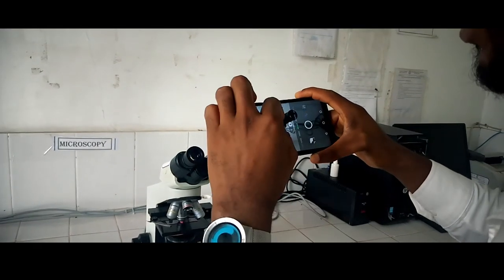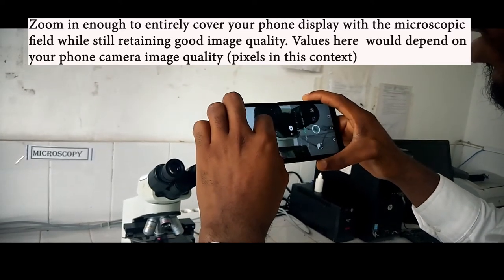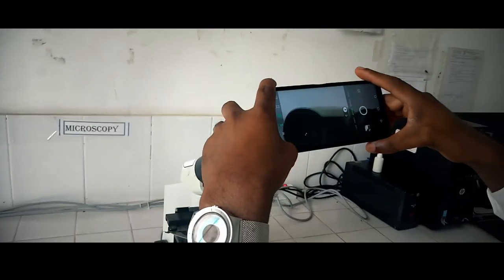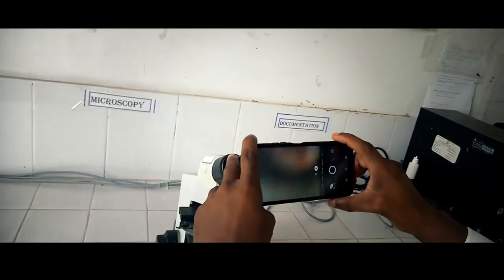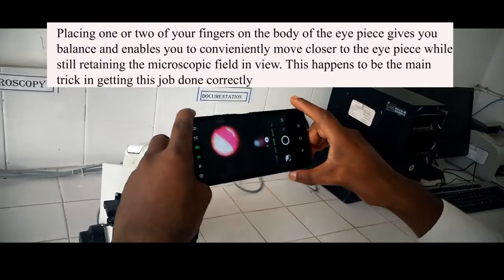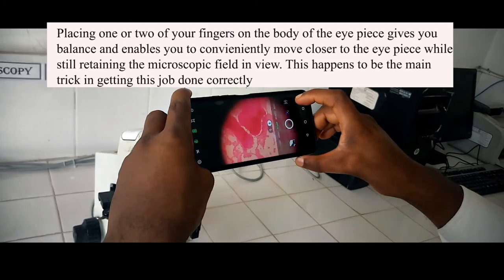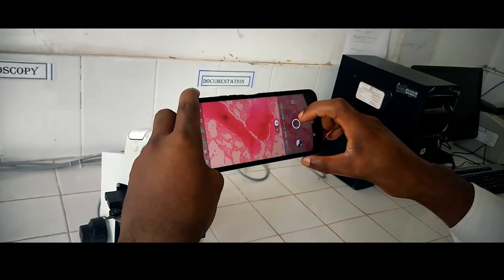I'll try to zoom a little bit so the quality of the picture is not really jeopardized. I think we can work with 2.1 — 2.1 is good enough. Now, there's a small trick here that I would like to show. I'm actually going to be sending the camera closer to one of the eyepieces, and I'm using my hand as a support. I'm using one of my fingers as a support, which actually acts like a wedge, so that I shouldn't move too much. Without the finger there, it might be a little bit too shaky. And I start moving into the ocular lens progressively — and here we have a beautiful image that I can snap.